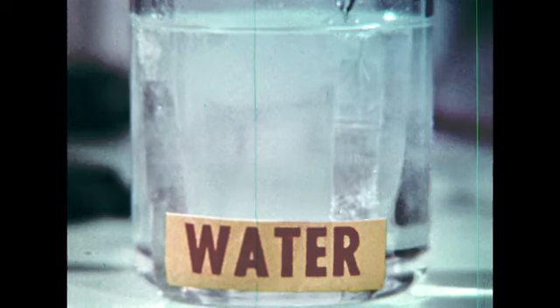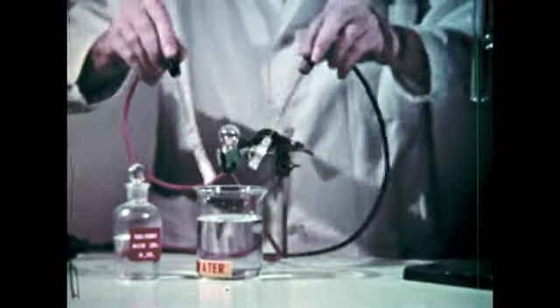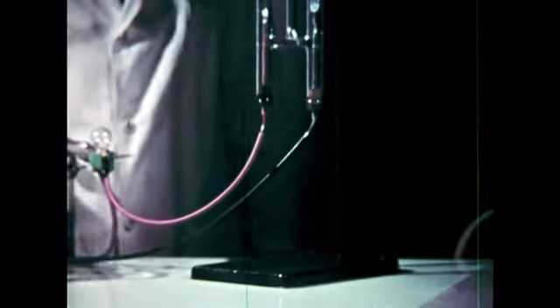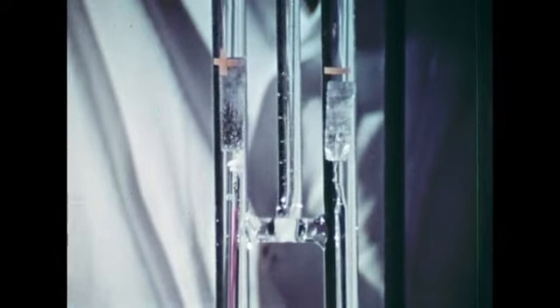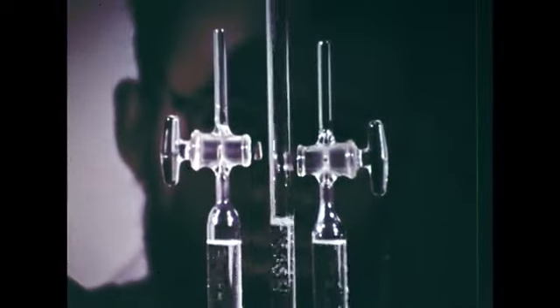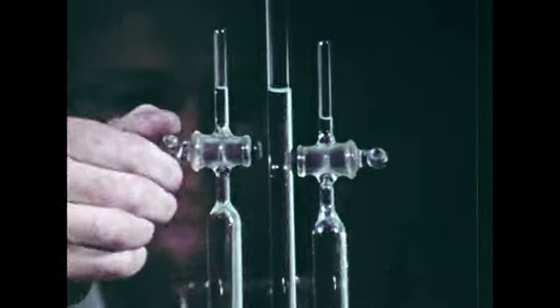The light goes back on, showing that the ions are now being drawn to the poles. So now we'll place the electrodes in this Hoffman tube, an apparatus which makes it easy to separate and collect the gases. Then we add the solution we just tested. As before, a gas is starting to be evolved at each of the poles. The stopcocks are closed to keep the gas from escaping, and we have only to wait until enough collects for testing.